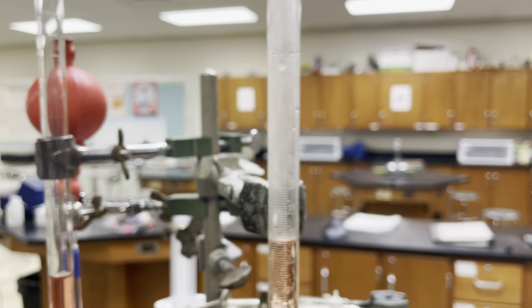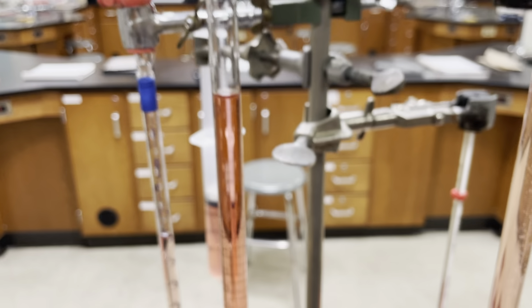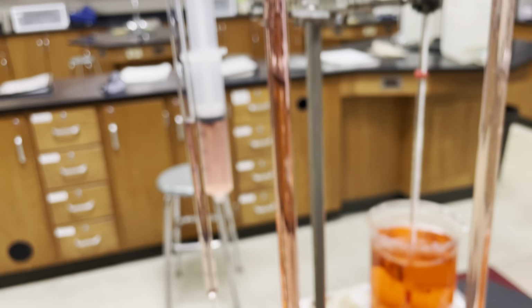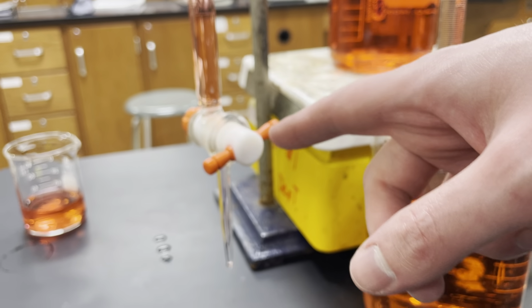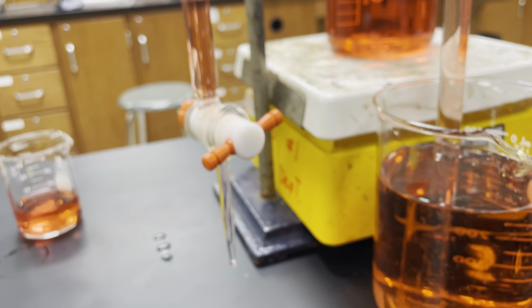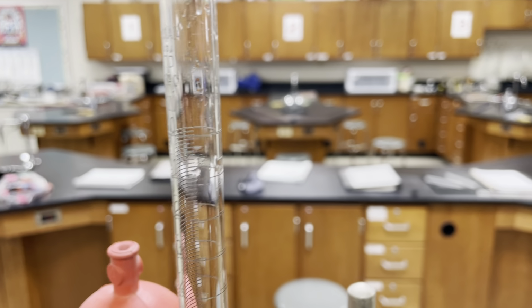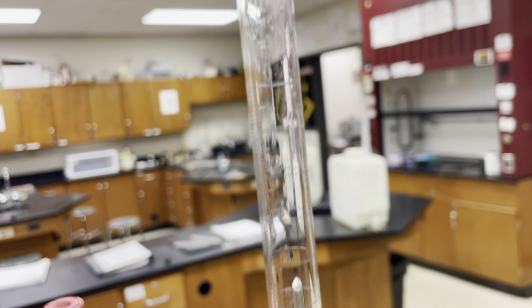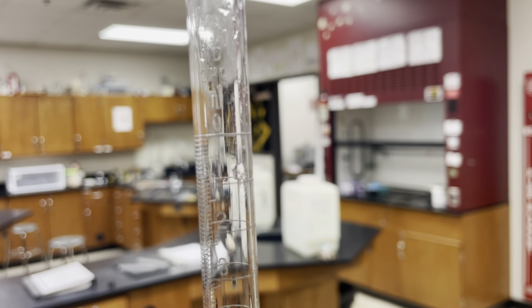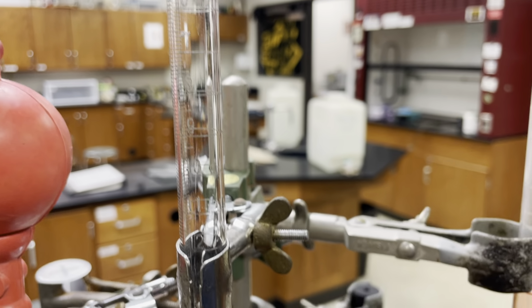Okay, let's look at some other examples. While we're here, let's come over to this guy. This is a burette. Its goal is to dispense a certain amount of liquid. We have a valve here at the bottom which we can use to control how much liquid comes out the other end. And if you look up at the top where our numbers start, again, if I can get this to focus here, you'll notice that the 0 milliliter mark is up at the top, and it goes down from there.